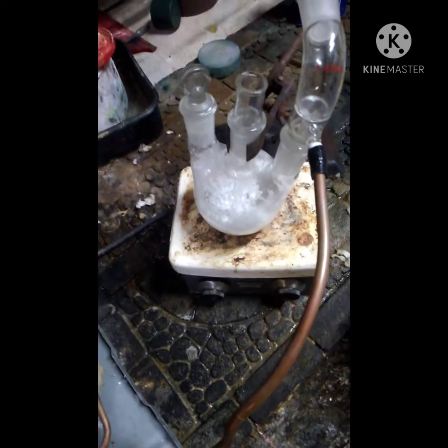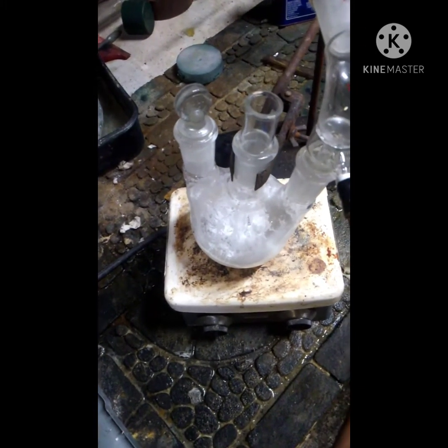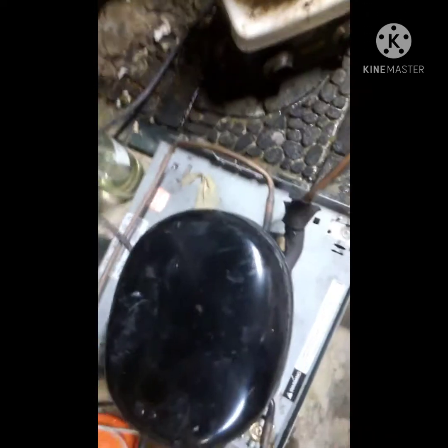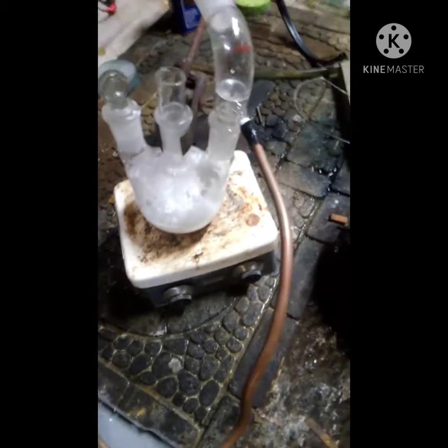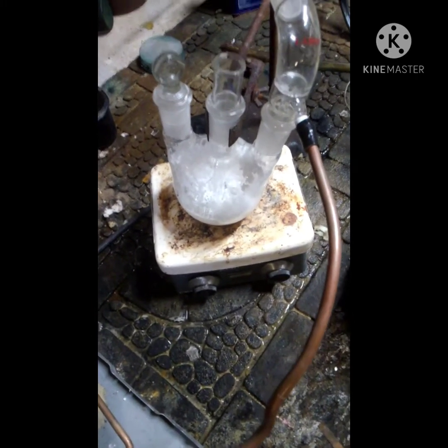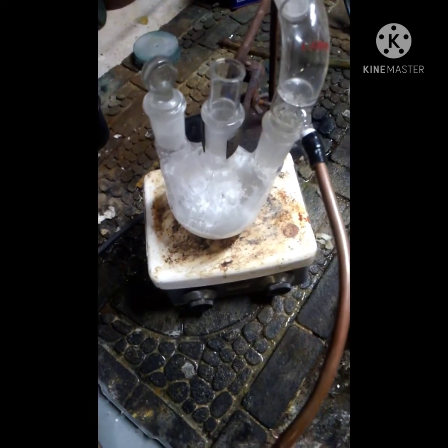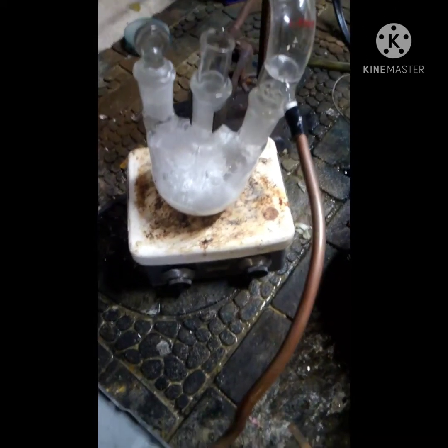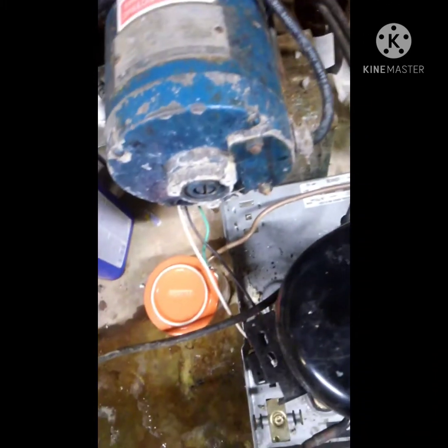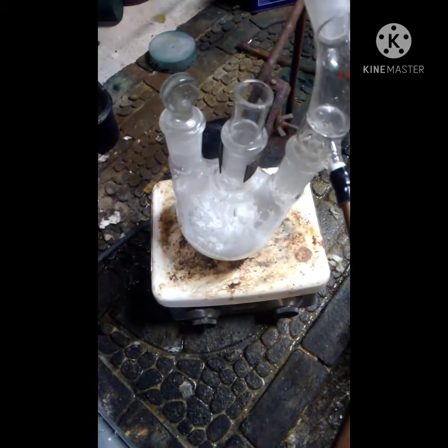It's been about an hour and 15 minutes until it stopped bubbling. Now the DCM needs to be evaporated off. I've got it going through a fridge motor for a vacuum pump — these fridge motors will get it down to negative 30 in a snap. They work great and they're free in most cases. I'm going to let this sit under vacuum overnight.